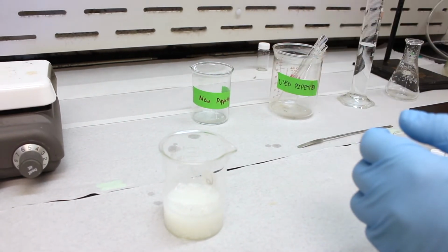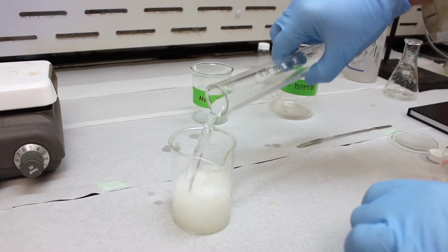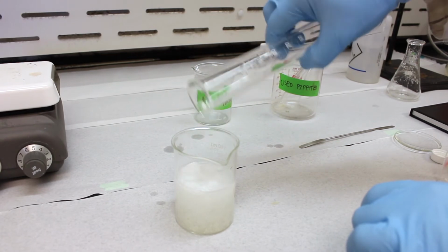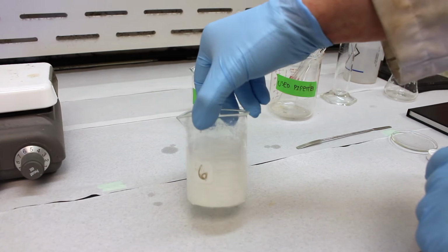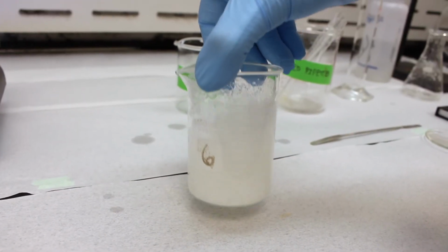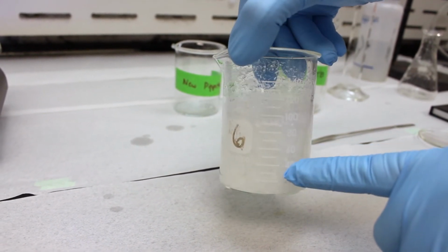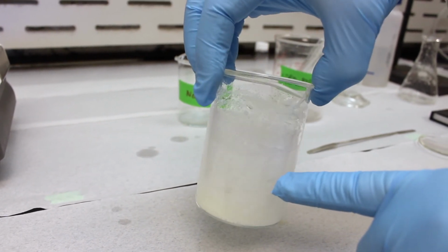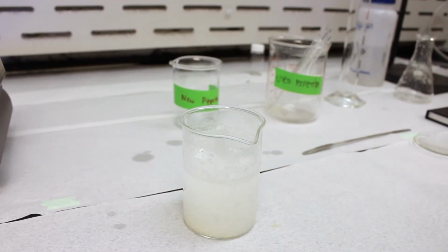And to finalize the recrystallization step, we're going to add 50 milliliters of water. So the total volume of water right now is somewhere around, well, since we squirted some for the transfer, the total might be somewhere in between 80 and 100 mils. Yeah, so we've got around 100 milliliters of total water here. But the exact value is not super concerning. You just don't want to have too much. So now that we have that, we can move on to the next step, which is to heat this mixture until all of it dissolves, and then we'll let it cool, and that will form the crystals.